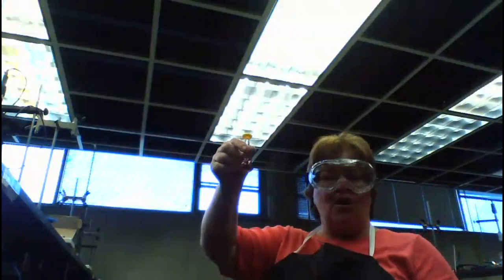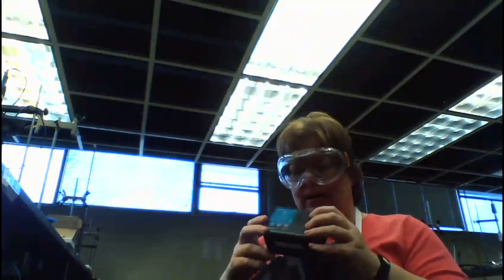Okay, so I am ready to measure the colorimetry, measure the absorbance of my solutions. I have some solutions made, and one is the strong, one is the dilution, and I'm going to measure the absorbance in my colorimeter. My colorimeter has a little hole on the side. Note that the hole also has a little triangle indicating the way the light is going.